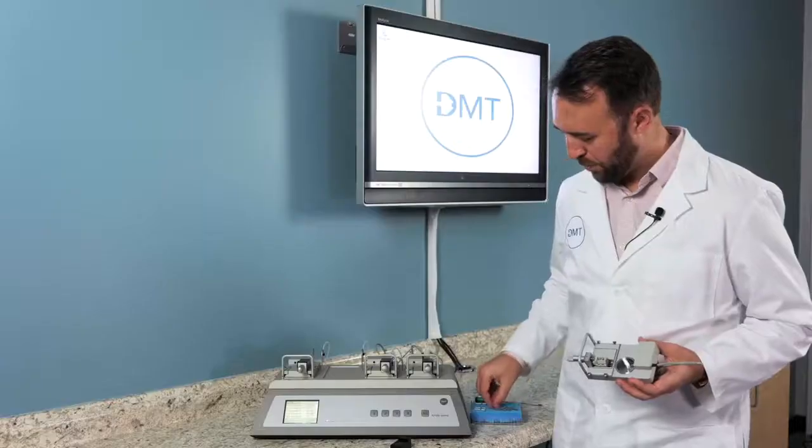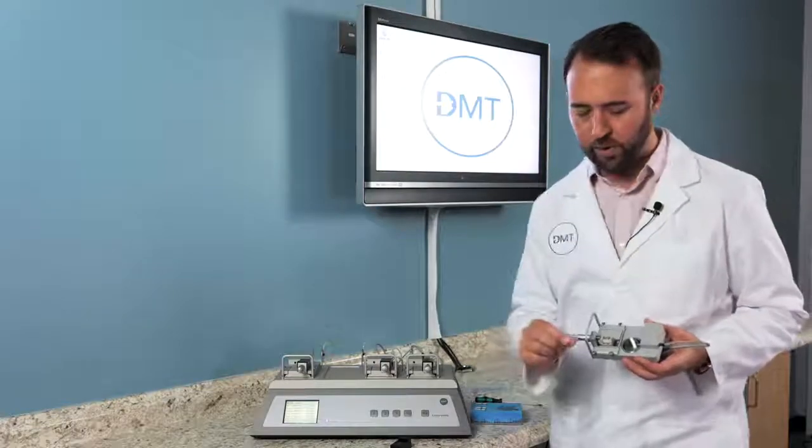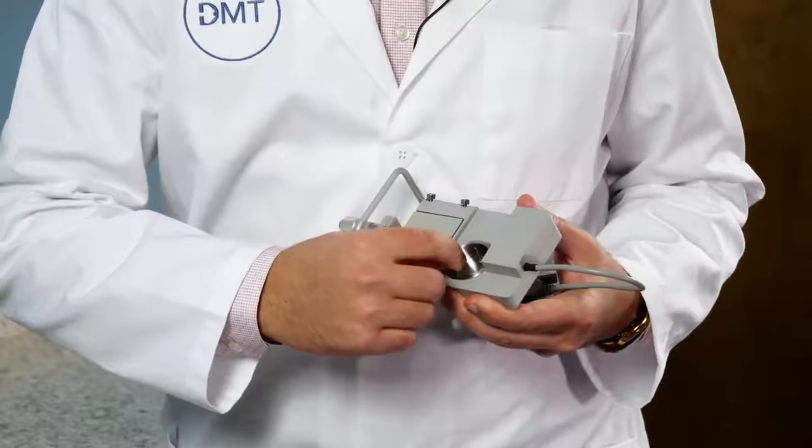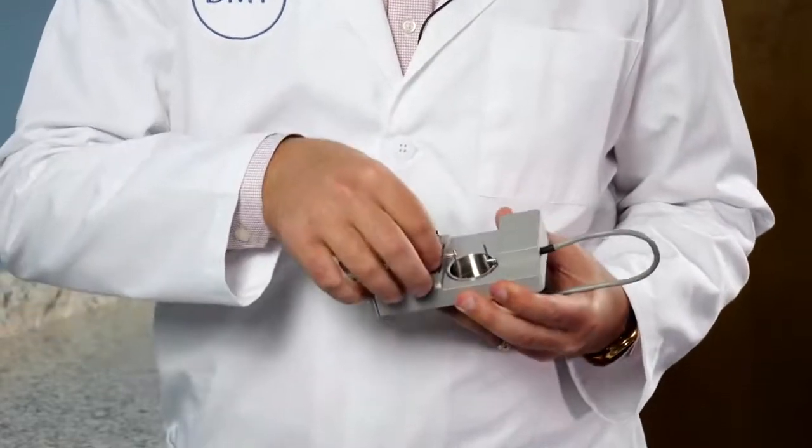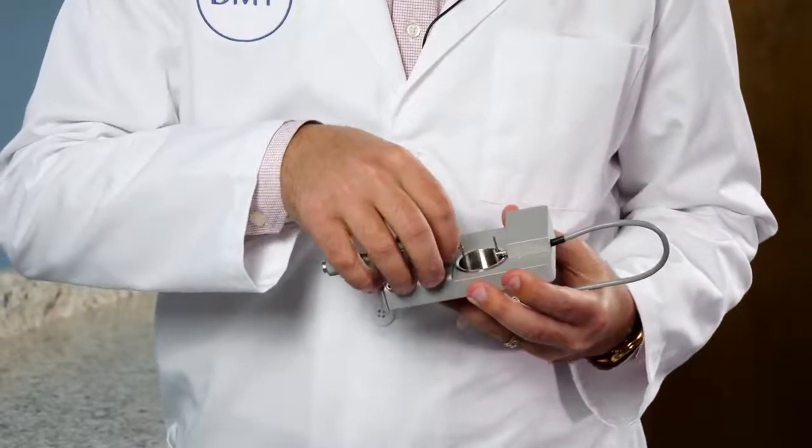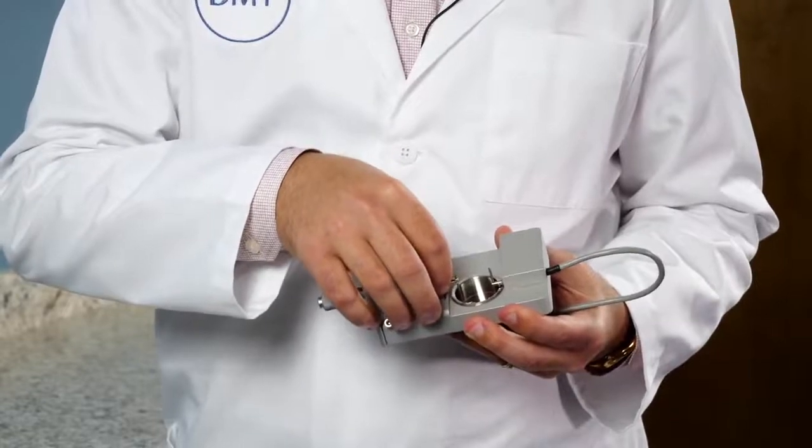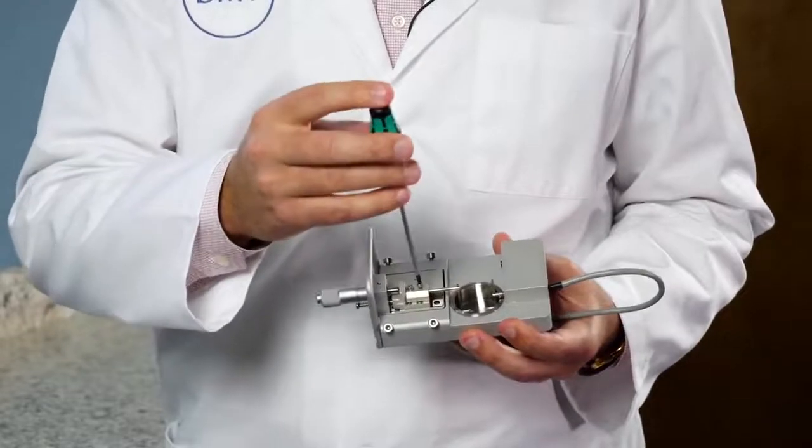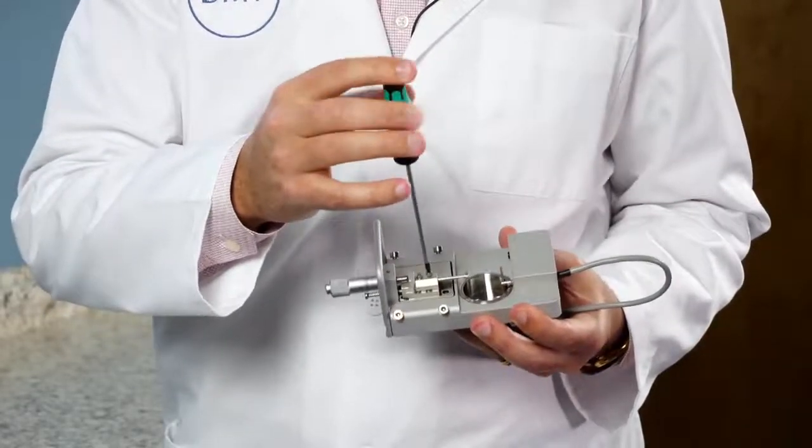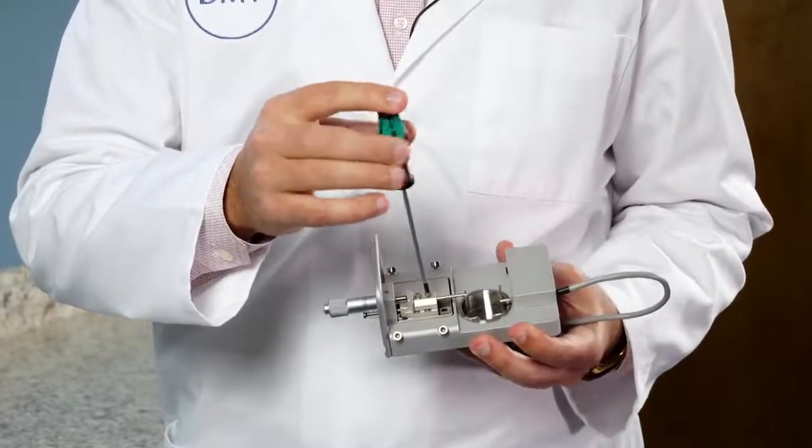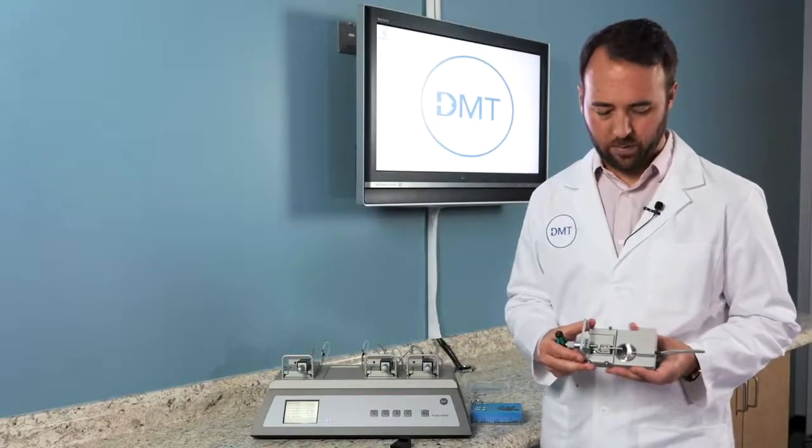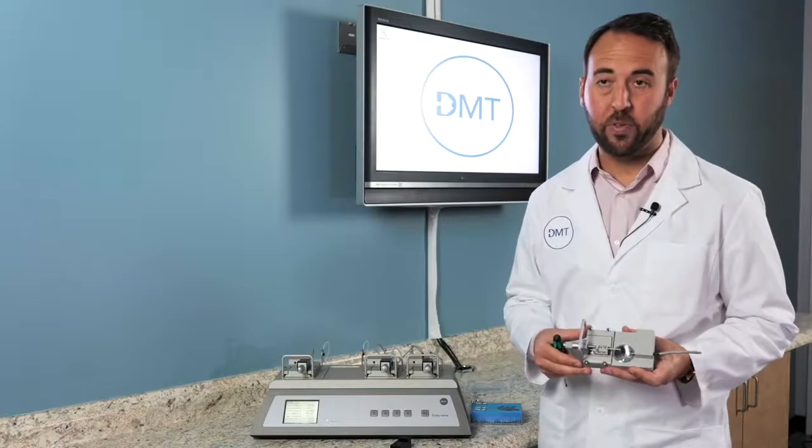Then we will grab the longer armed mount and slide that in to the micrometer side. Take your ball end screwdriver and tighten the closest screw. These will not be perfectly aligned, but you will do that under a microscope in the next step.